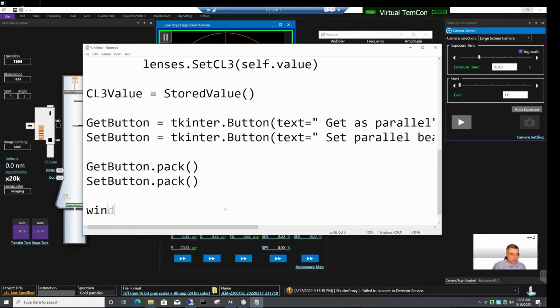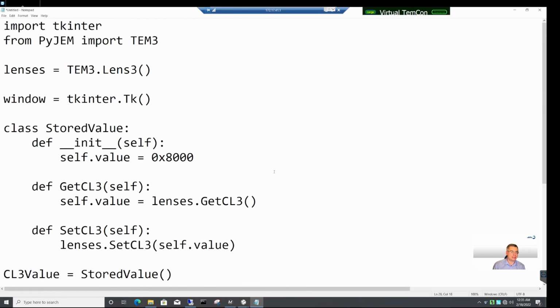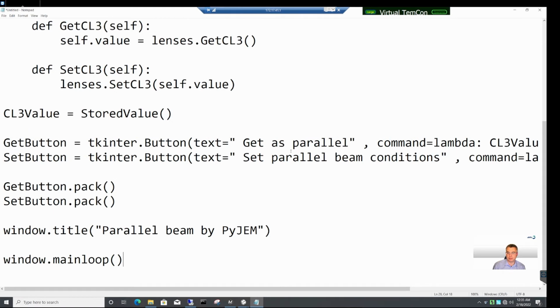And then finally, just for fun, we can set the window title, and maybe let's call it parallel beam by PyJEM. Here we go, and then the final command, as usual in graphical applications, tells Python to enter the event loop and wait for user interaction. So that's it. A simple application like this should be enough to provide a button that gets and a button that sets the parallel beam condition.